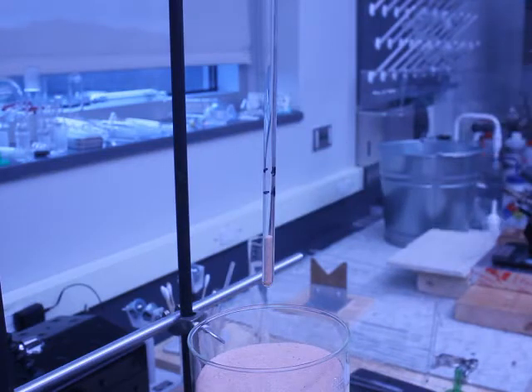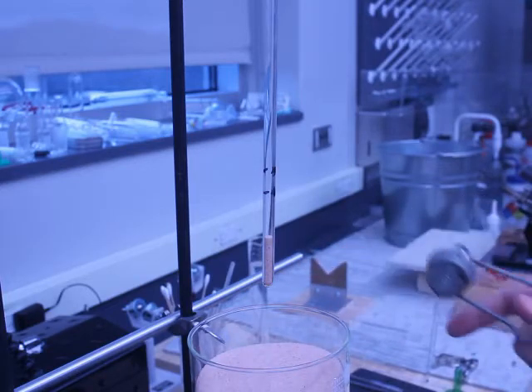That was the sound of a small vacuum pump, the type that's used for sealing food. What I'm going to do now is show how to flame seal a sample in a glass tube.